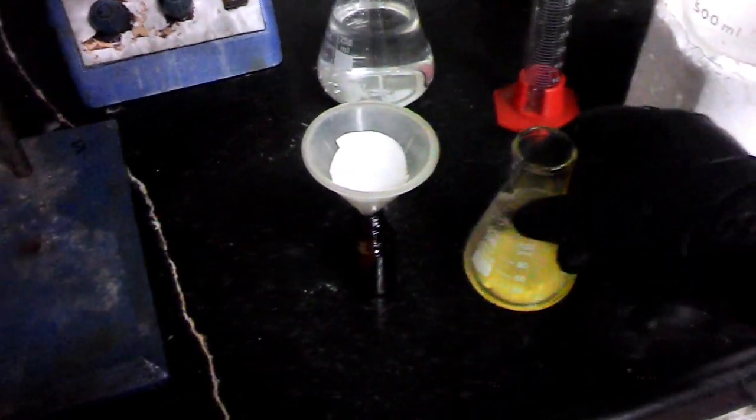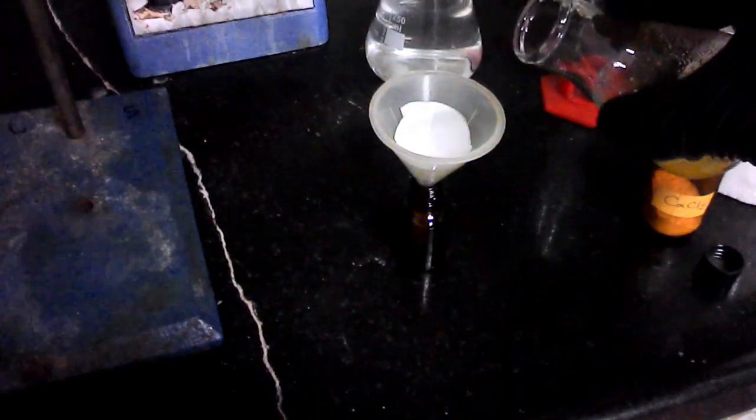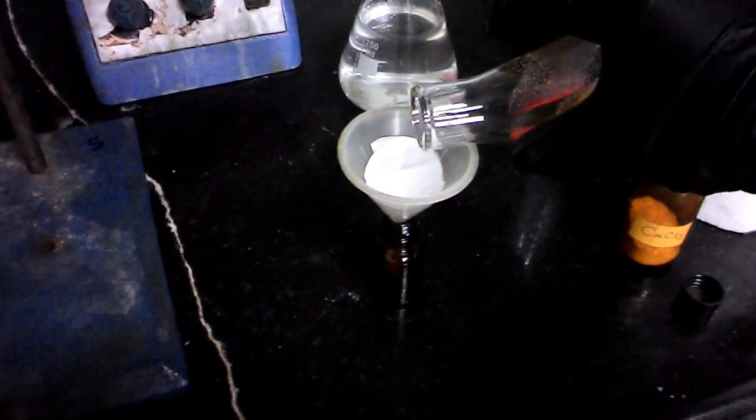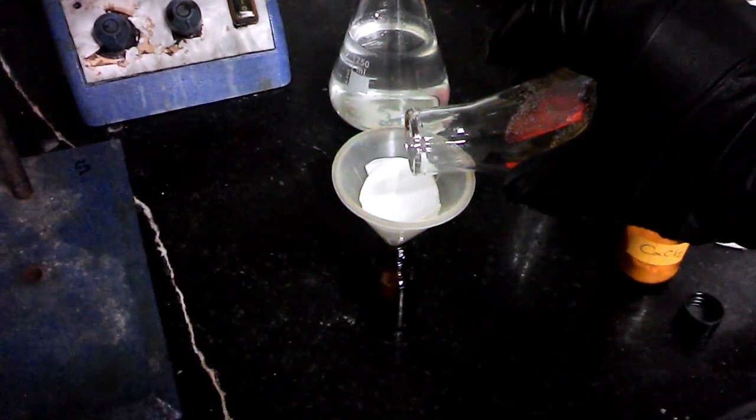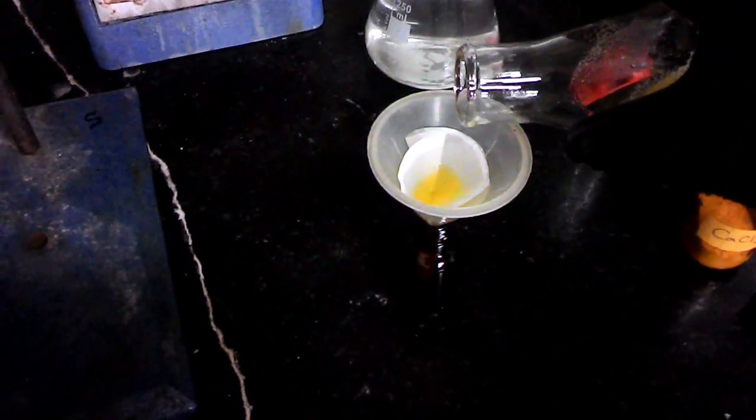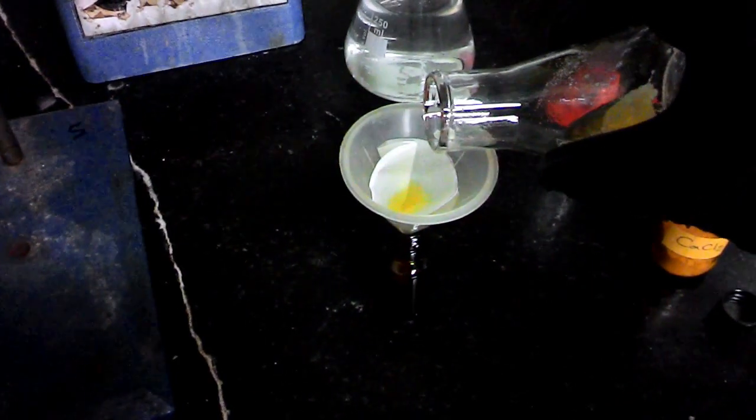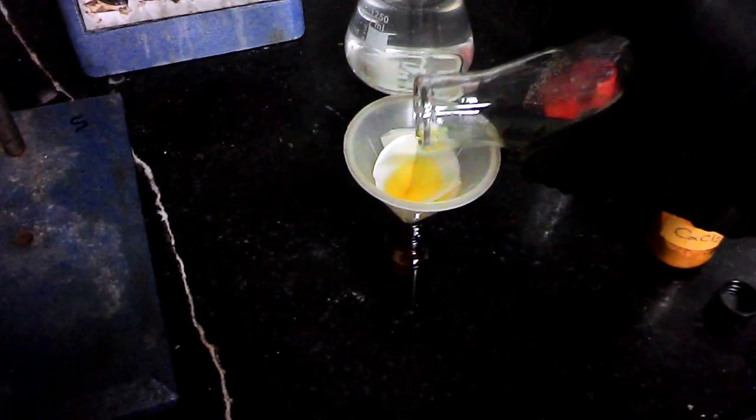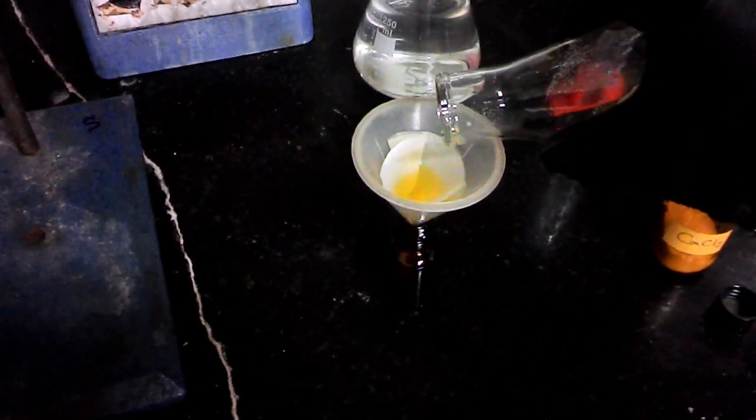And then filtering it into an amber glass to avoid light degradation. I used a little filter to avoid the loss of my product.